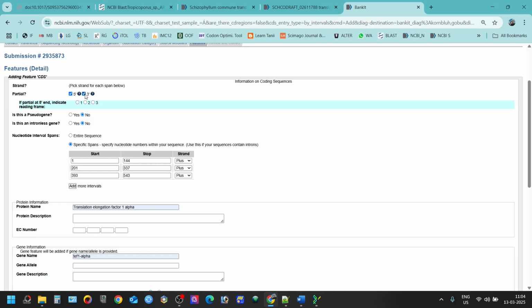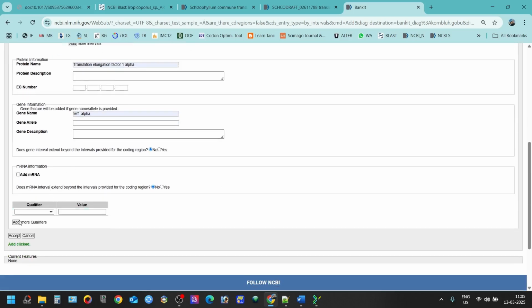So we have to click here, and now we have to mention the reading frame. We know we have three open reading frames, 1, 2, and 3. You must know about open reading frames, I'm not going to explain that. Then click one here and press. This is a partial sequence, and you don't have to do much here. You can write this is a partial CDS of translation elongation factor 1 alpha. Now we're done. Just click accept.